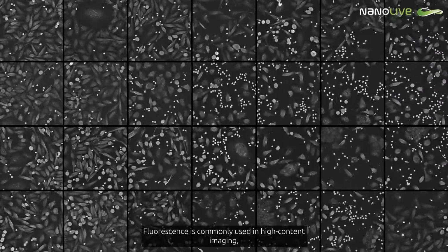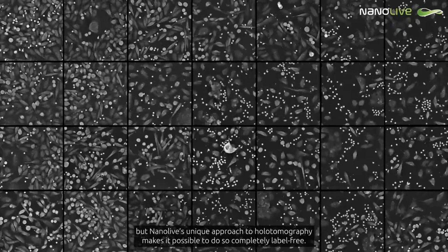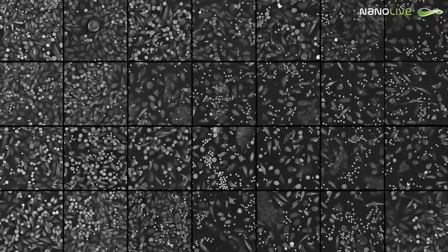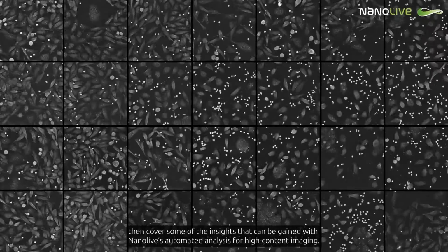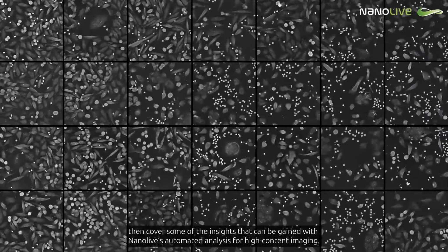Fluorescence is commonly used in high-content imaging, but Nanolive's unique approach to holotomography makes it possible to do so completely label-free. Let's explore why label-free imaging is so important for the phenotypic study of cells, then cover some of the insights that can be gained with Nanolive's automated analysis for high-content imaging.